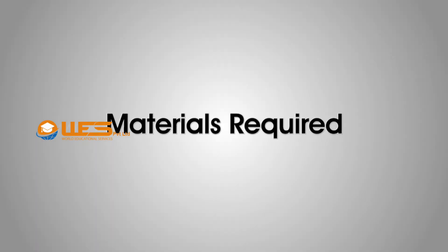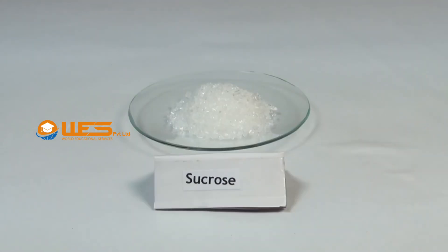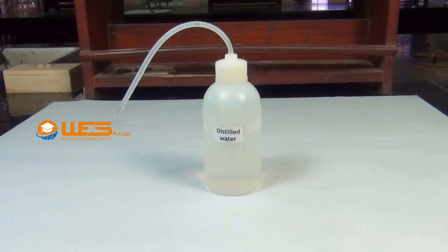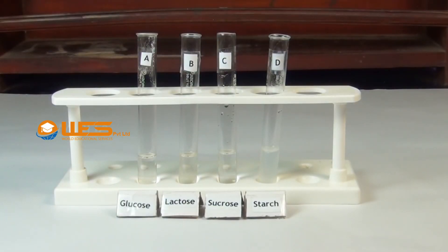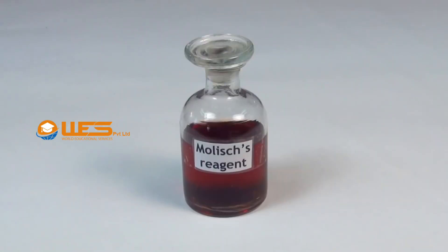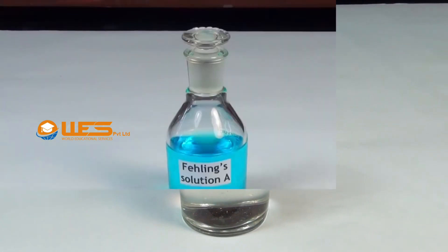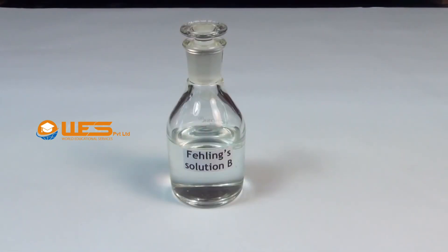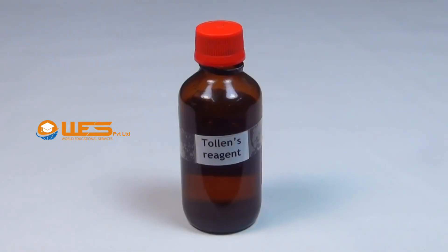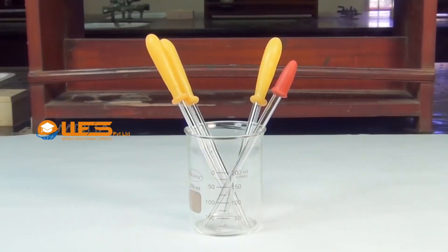Materials required: glucose, lactose, sucrose, starch, distilled water, aqueous solutions of glucose, lactose and sucrose, suspension of starch, Molisch reagent, concentrated sulphuric acid, Fehling's solution A, Fehling's solution B, Benedict's reagent, Tollens reagent, iodine solution, test tubes, droppers and water bath.